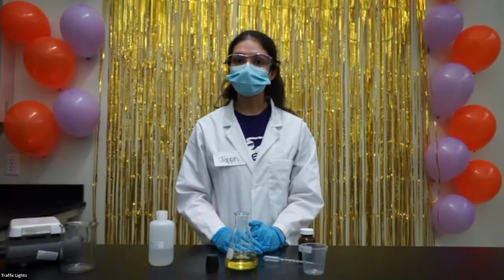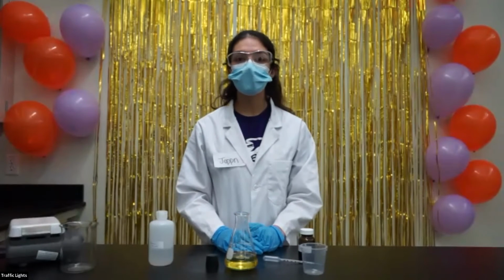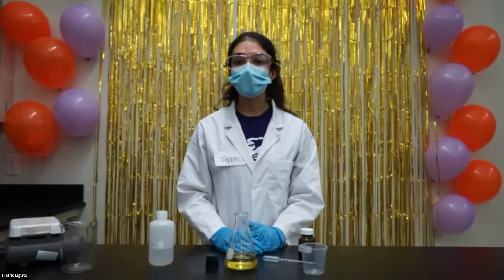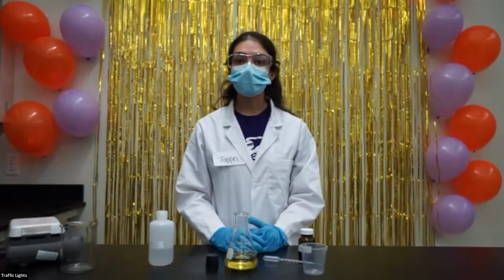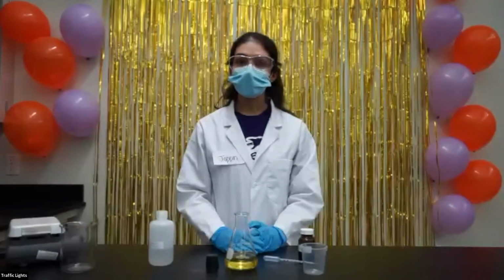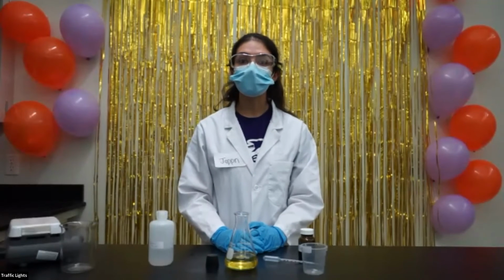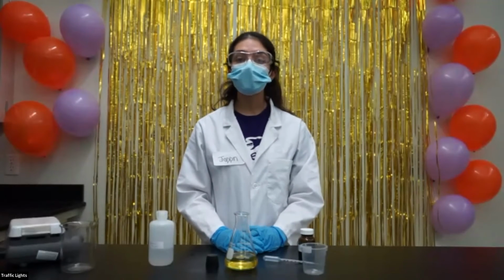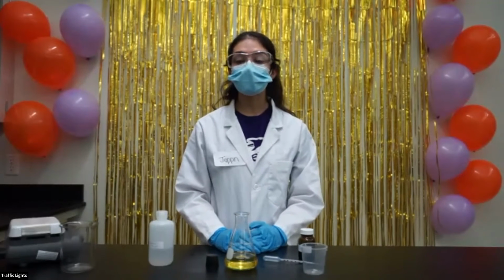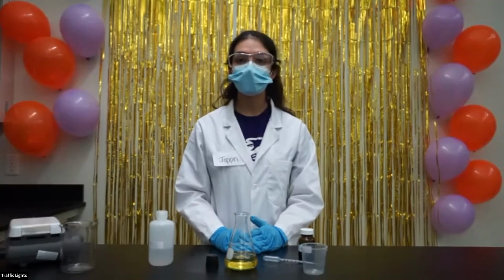So sodium hydroxide, because it's a strong base, is going to have a very high pH. So indigo carmine, when it encounters a strong base around the pH of 11 and 12, changes to a green color. And this is because indigo carmine becomes oxidized. Oxidation is when a compound loses its electrons. Electrons are these teeny tiny negatively charged particles. So when we added in that sodium hydroxide, indigo carmine became oxidized and turned green.